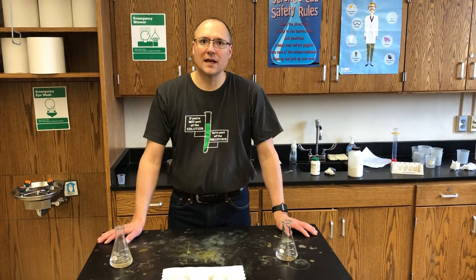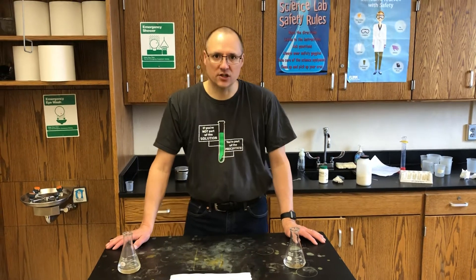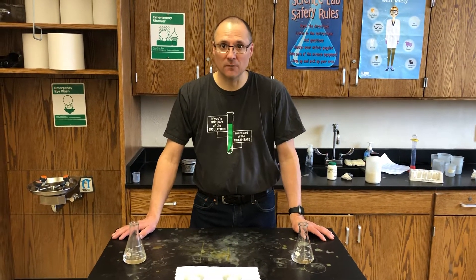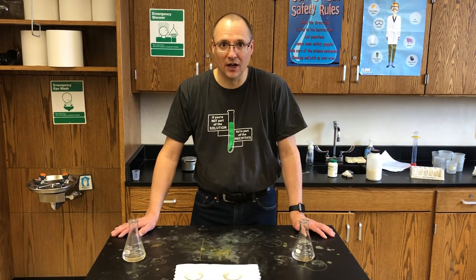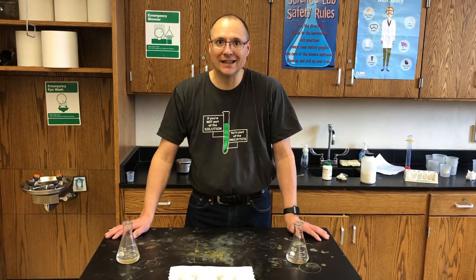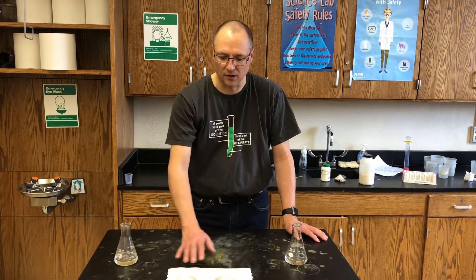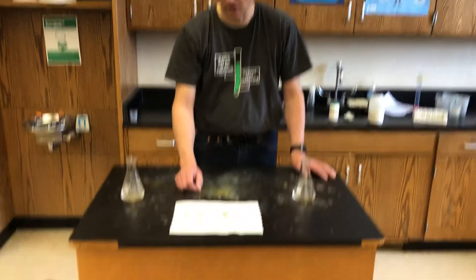It's Mr. Wise. We're going to talk today about chemical reactions, and what I'm going to do for you today is to demonstrate a chemical reaction — one that you will find in your notes. I have you labeling this equation in your notes. I don't have the full equation written down here, but we'll focus on this area down here.